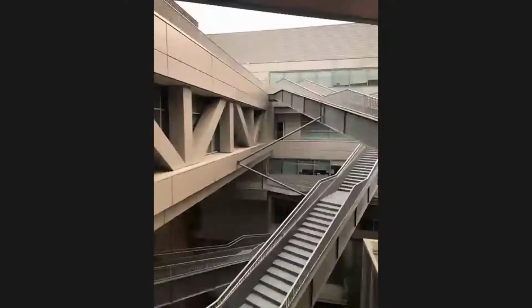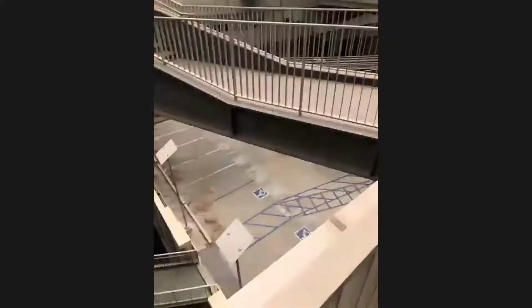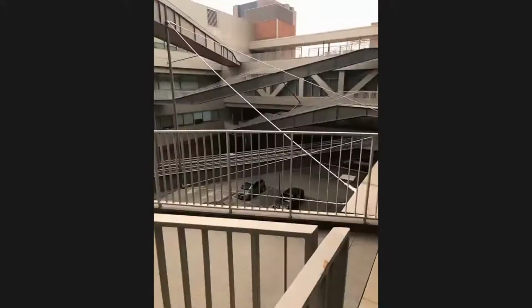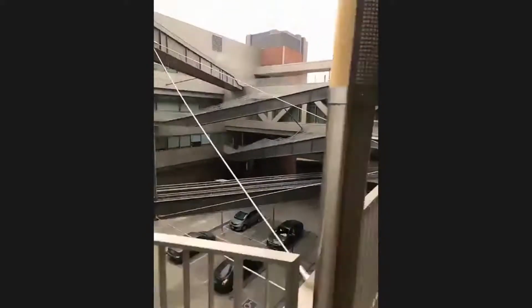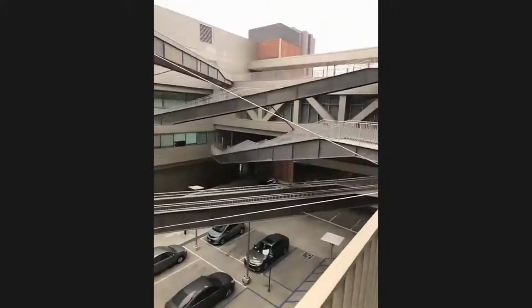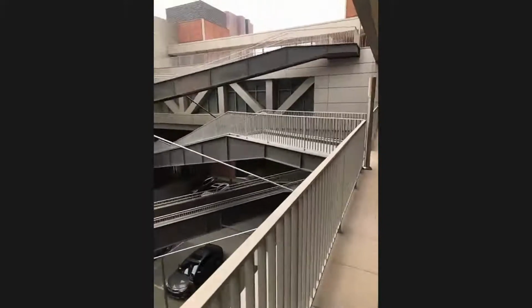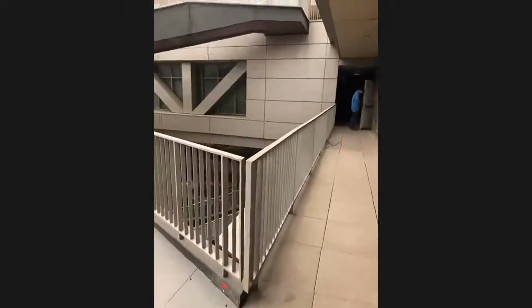So the Institute is quite large. It's 190,000 square feet. It's actually built over the top of a parking structure here at UCLA. But there's a lot of different activities that happen inside of here. There are research laboratories, as I mentioned, startup companies, and our technology centers, which is some of what we've highlighted this morning. All focused on bringing teams of scientists together from different disciplines.